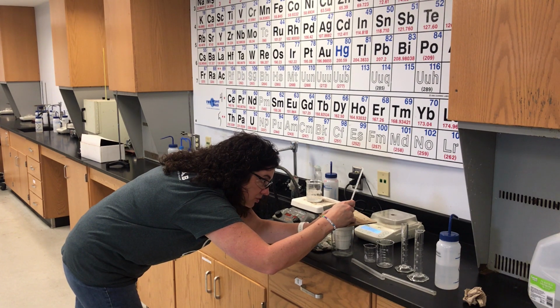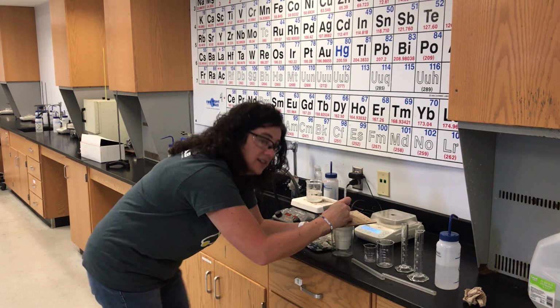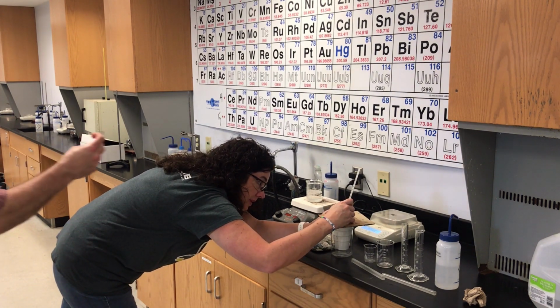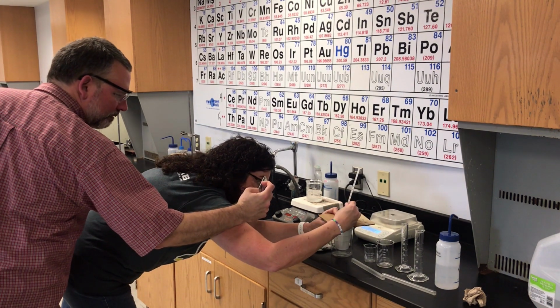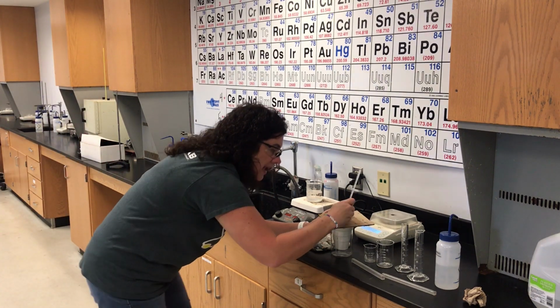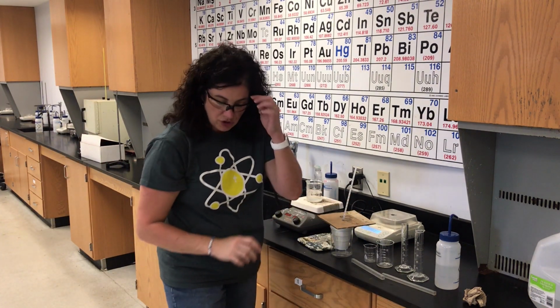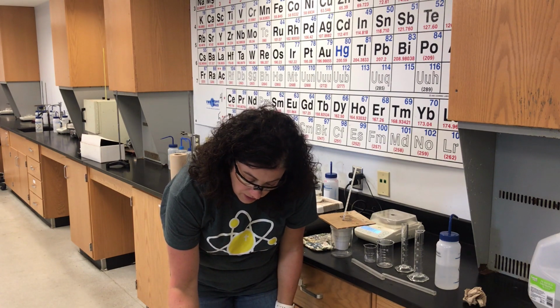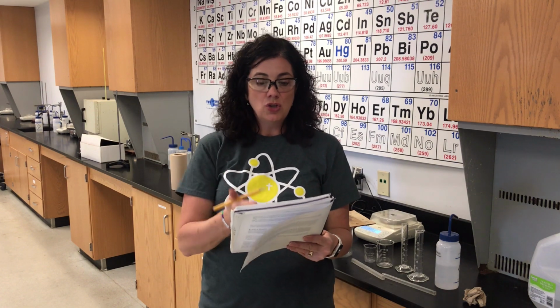The highest temperature I reached is 28 degrees Celsius. Check and see if it's moving anymore. I'm kind of starting to back off of that. So 28 degrees Celsius. So the equilibrium temperature of the metal and the water in the calorimeter is 28 degrees Celsius. Okay? That is all the data you need for trial 1.